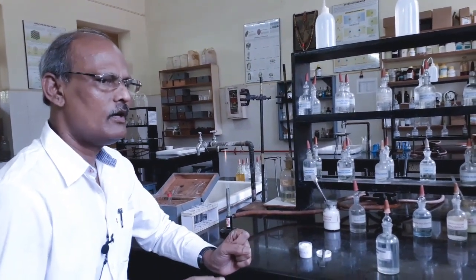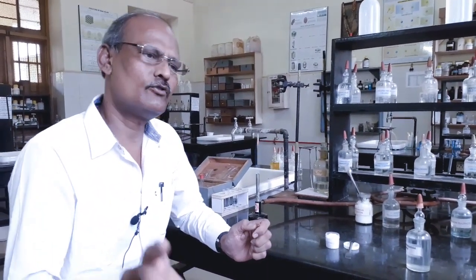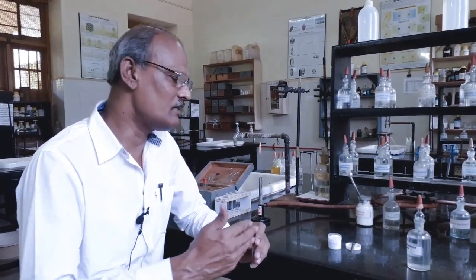Remember, first group and second group basic radicals are excluded from the syllabus, both from the practice as well as from the practical exam syllabus. However, for the students, we are going to demonstrate in the class the absence of first group and second group basic radical.